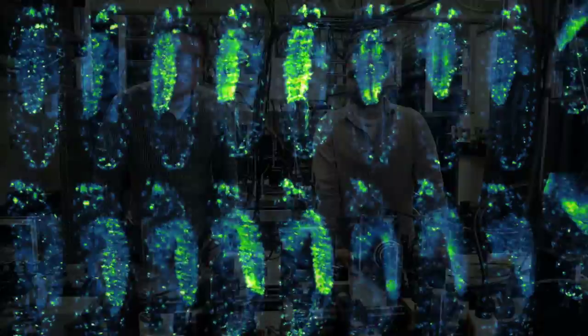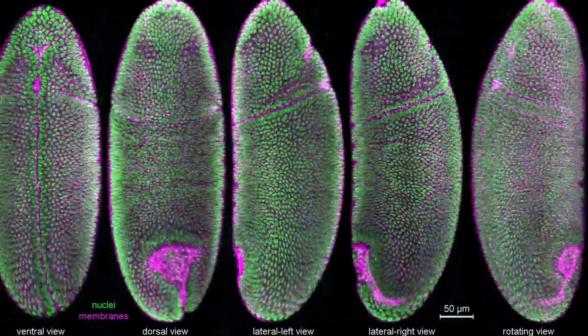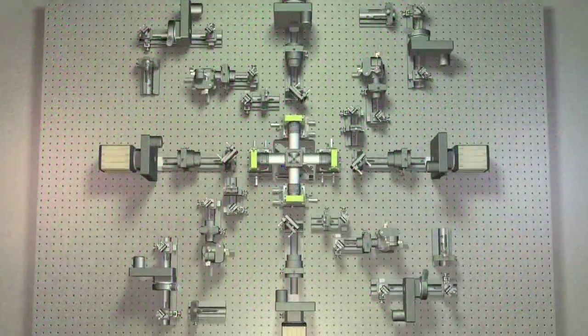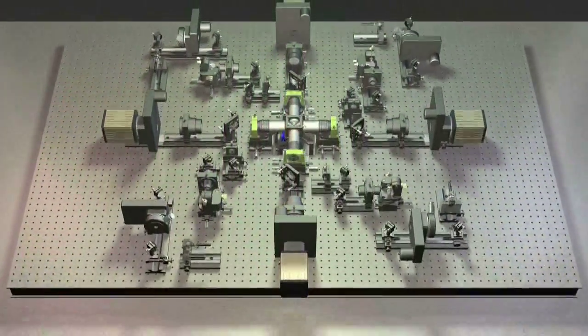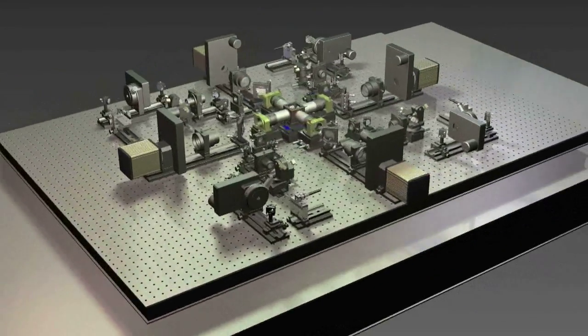This is the new IsoView microscope, the light sheet microscope for isotropic multi-view imaging, which was designed and built by Raghav and myself. And as the name suggests, what we can do in this microscope is look at a fairly large sample volume from four complementary views at the same time. These views are oriented at right angles to each other with these four identical subsystems.